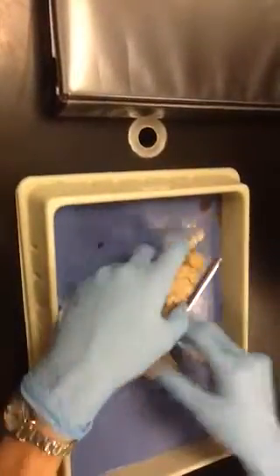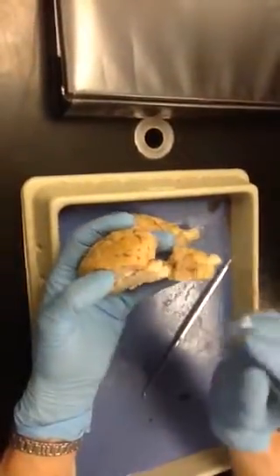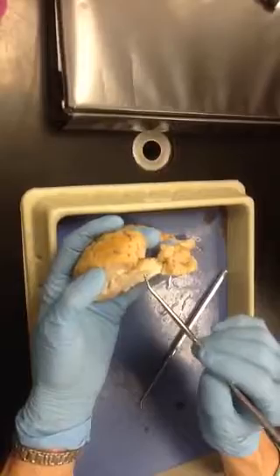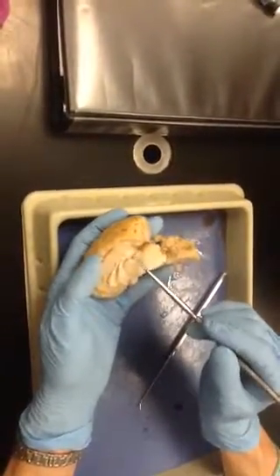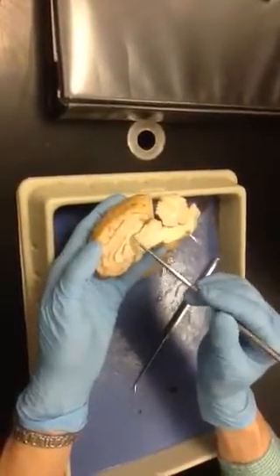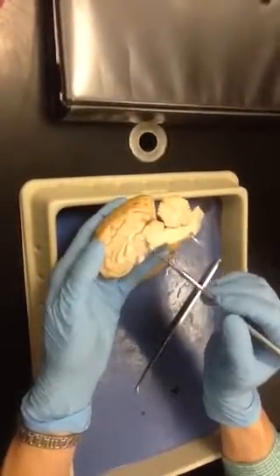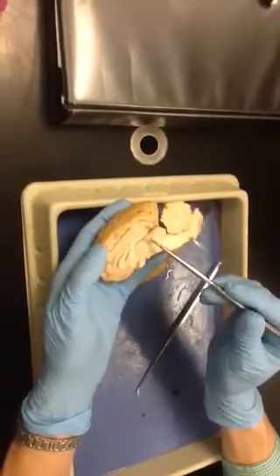Okay? So again, if we take our half brain and we pull it down, here's our superior colliculi, here's our inferior colliculi, and then this sticking up in the back would be the pineal gland. Okay? Just a different view. Okay, so lateral ventricle, third ventricle, fourth ventricle, the aqueduct comes around. This is the thalamus, this is the hypothalamus, that's the pineal gland right there.